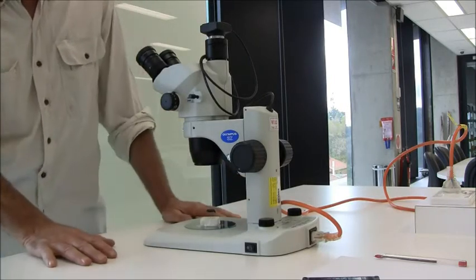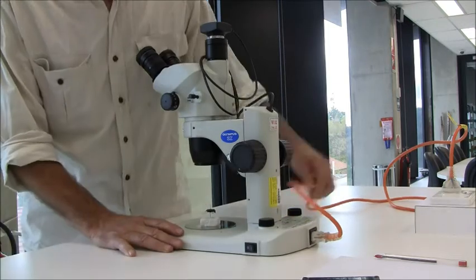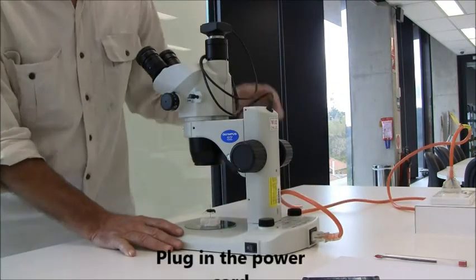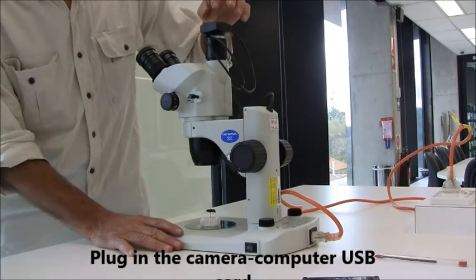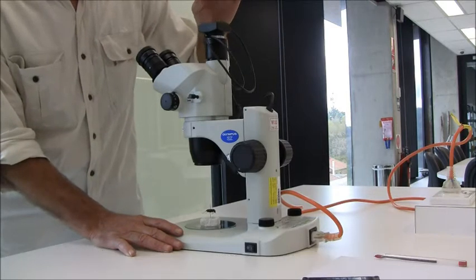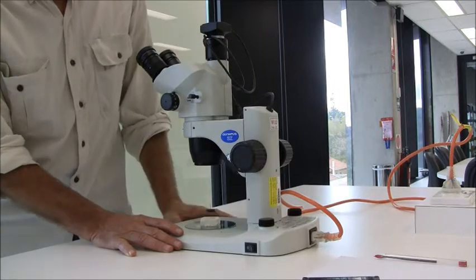So the first thing we do is plug in the power cord and plug in the USB for the camera. And we'll be talking about the camera program a little bit later.